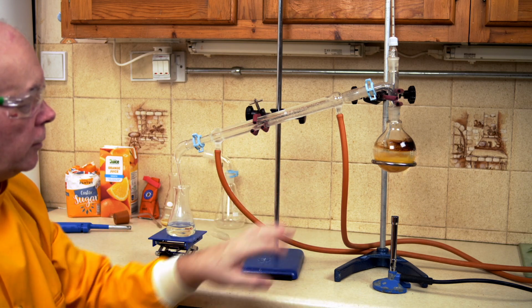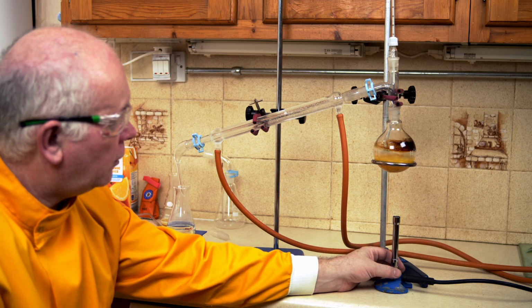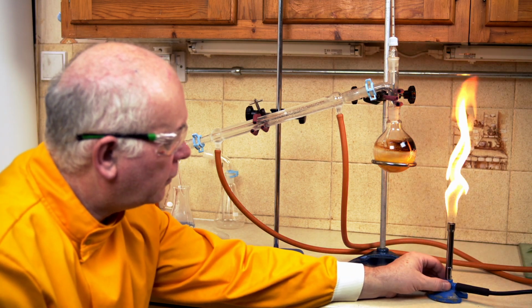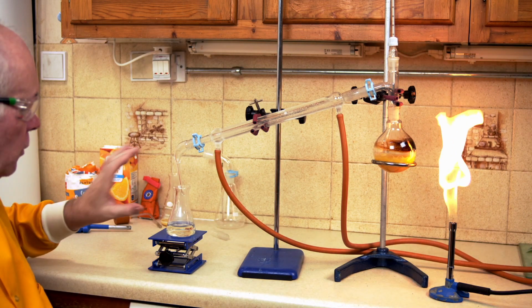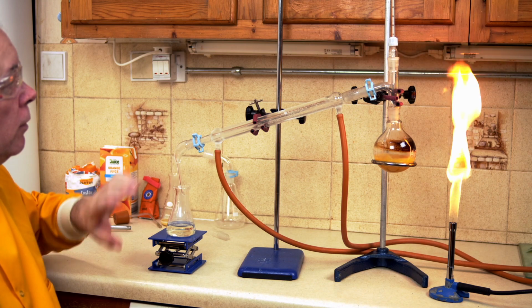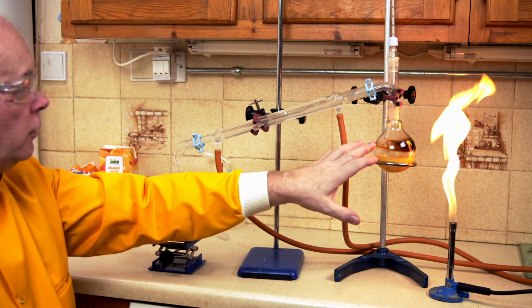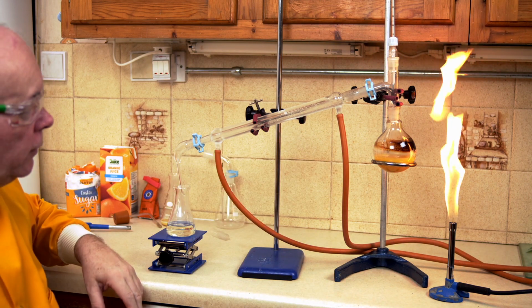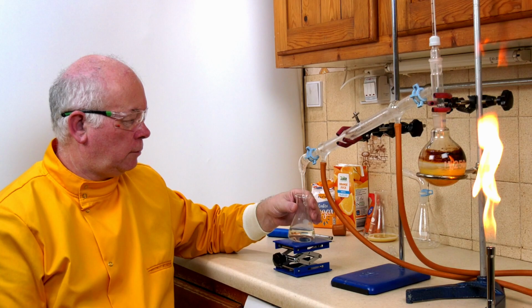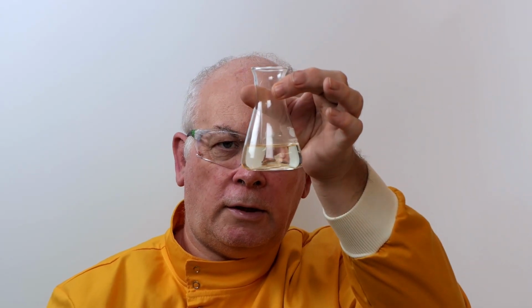And we are separating out by distillation at different temperatures, in this case alcohol and water. So there we are, this is distillation, separating the water and alcohol mixture into alcohol and leaving mostly the water behind. There we are, nearly pure alcohol.